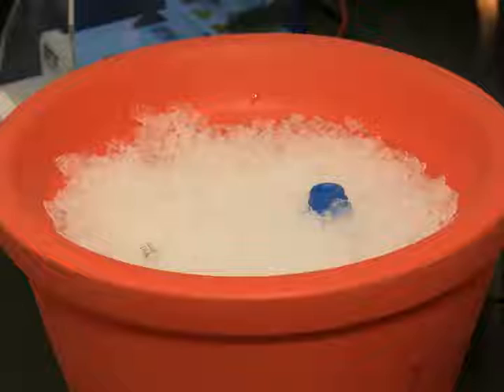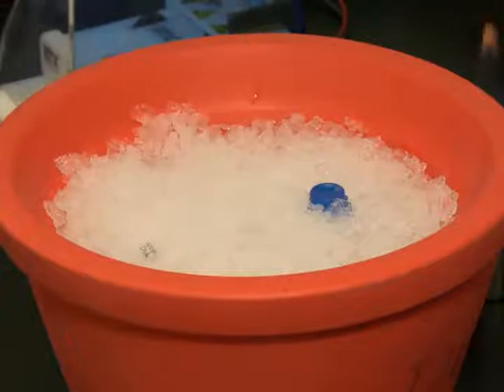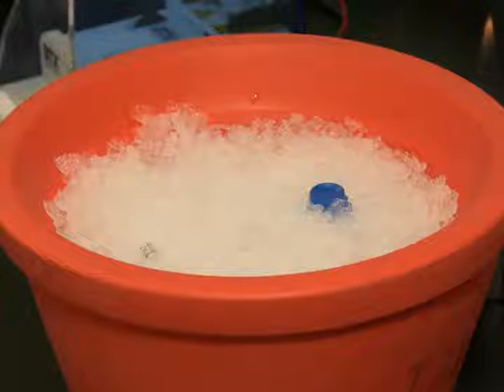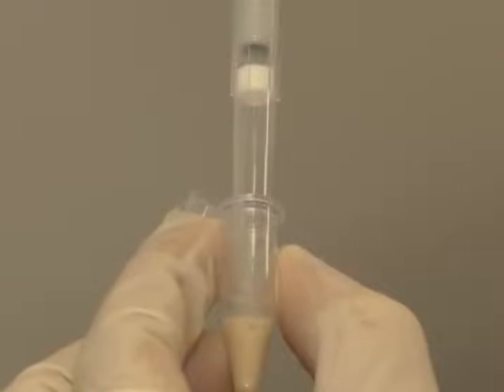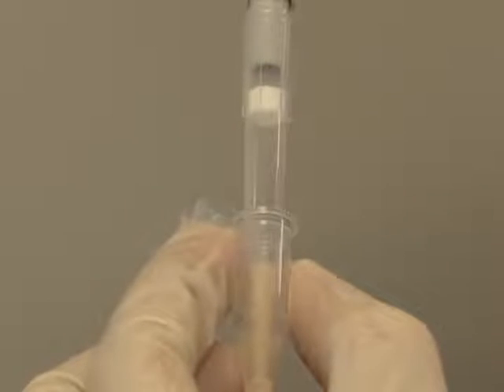Next, thaw a 350 microliter aliquot of electrocompetent E. coli SS320 on ice. Add the cells to the DNA and mix thoroughly by pipetting several times. Avoid introducing bubbles. Afterward, transfer the mixture to the cuvette.